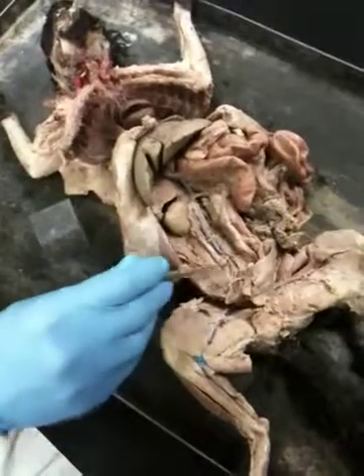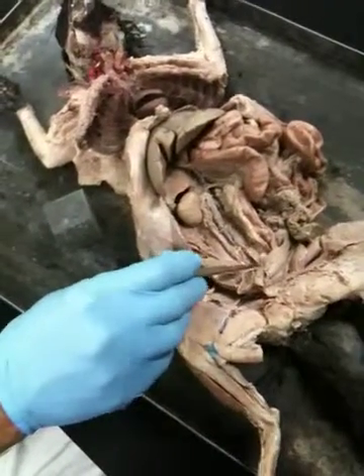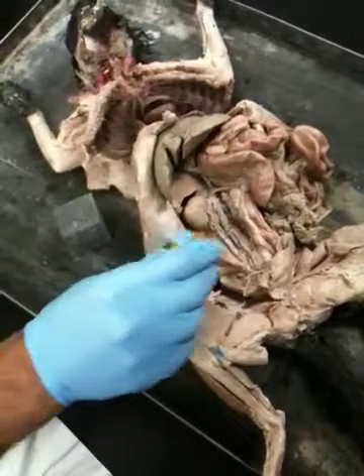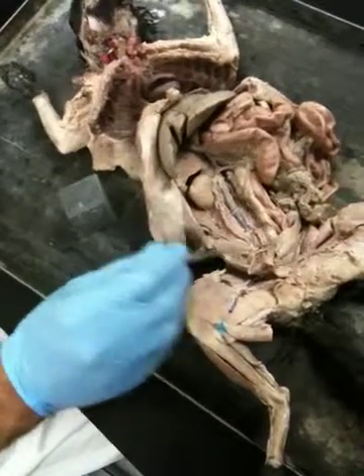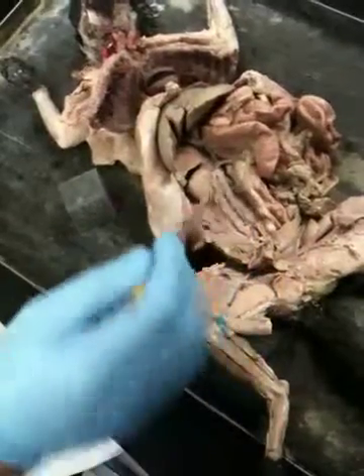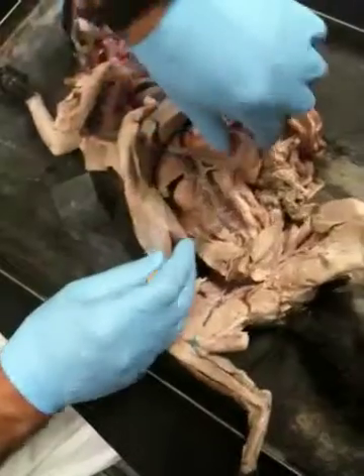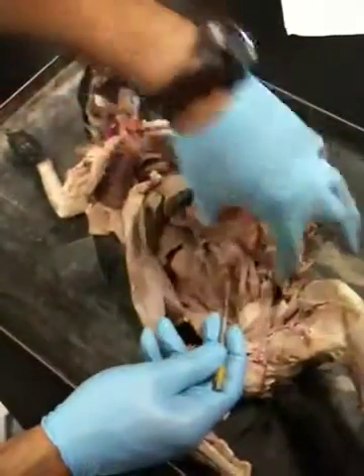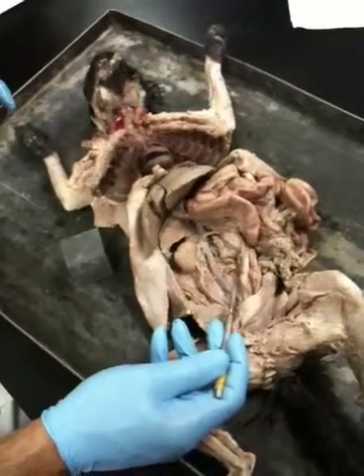So you've got a V, an opposite V, and then another V. Okay, so external, internal, and middle sacral. Same thing with the vein. Okay, common iliac, and then external, and then internal, same thing. Okay, so you go up there, and then you try to locate the ones that are going towards the digestive system. That's the inferior mesenteric.